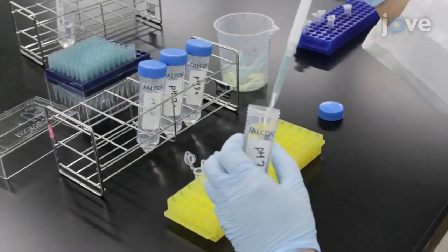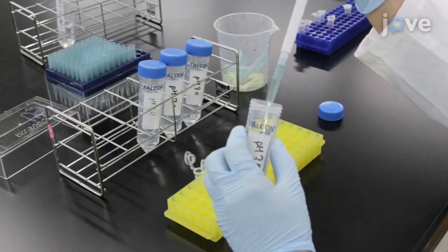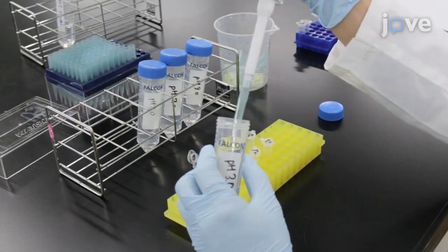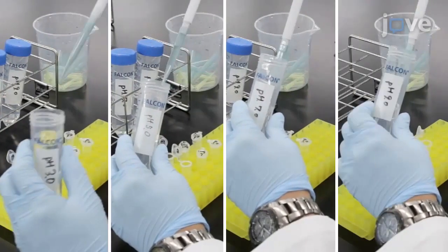To clarify the difference in protease specificity depending on the pH, use digestion buffers adjusted to pH 3, 5, 7, and 9.